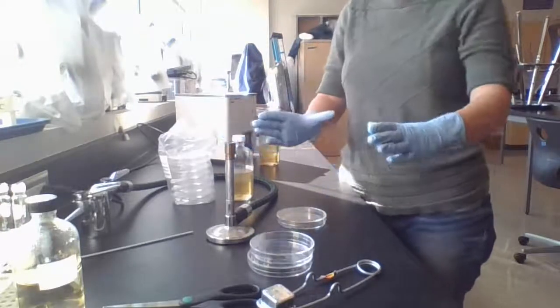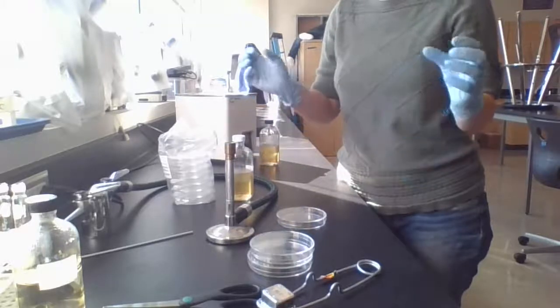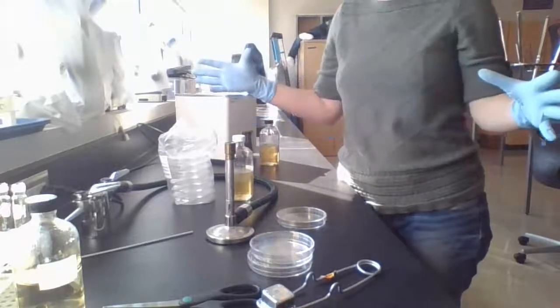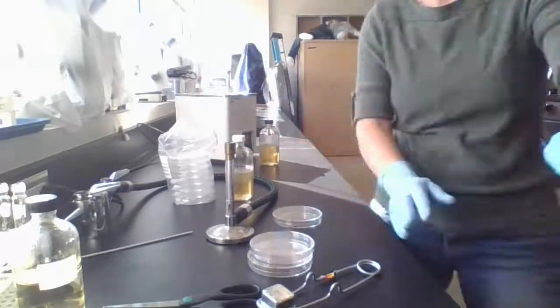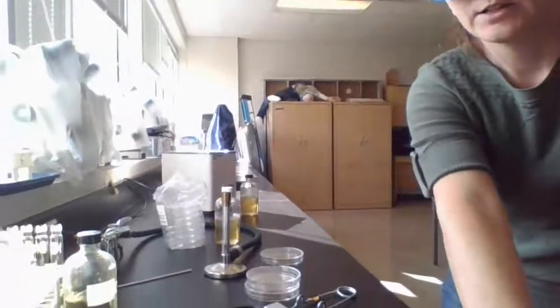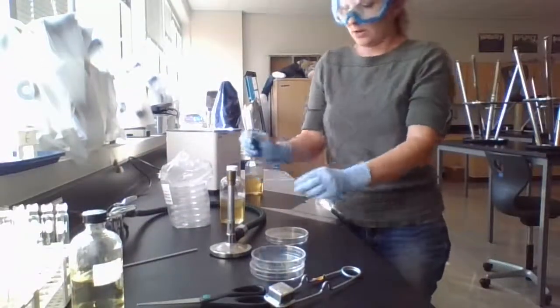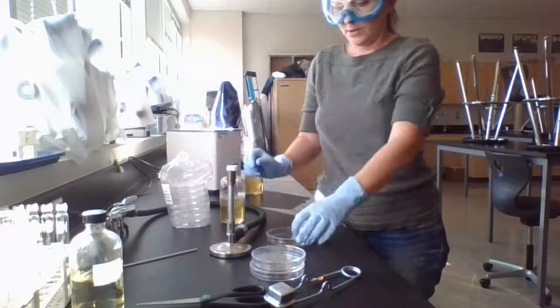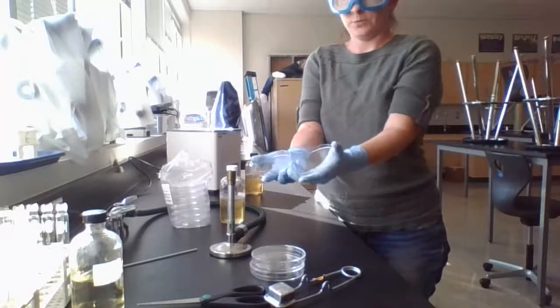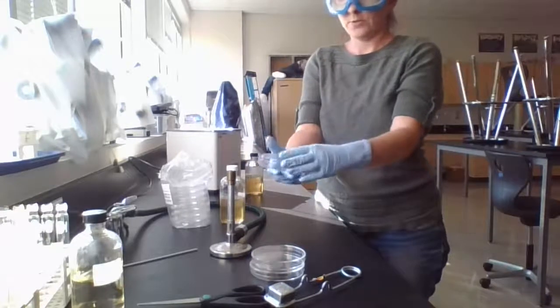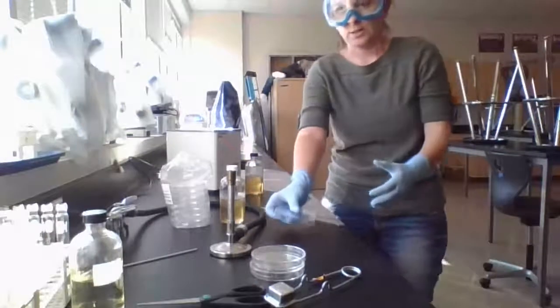Now within a good foot or so of the Bunsen burner is sort of our sterile area. Okay, so we've got high pressure here pushing out the air. So things are not going to be floating into this area. So I'm going to make sure that all the work that I do is within this area here. So here I've got my agar. When you open these petri dishes, you don't want to just open them flat and just leave them there. Because again, there's things kind of floating around. And even when you're within this space, it's always good to just practice good techniques.